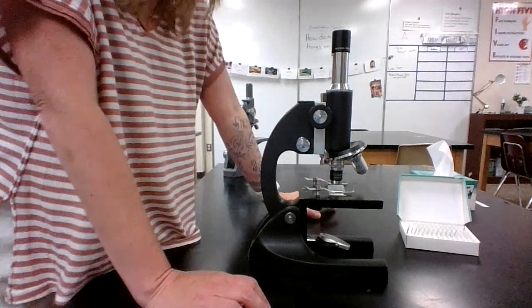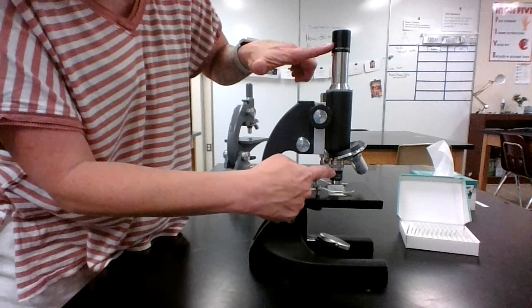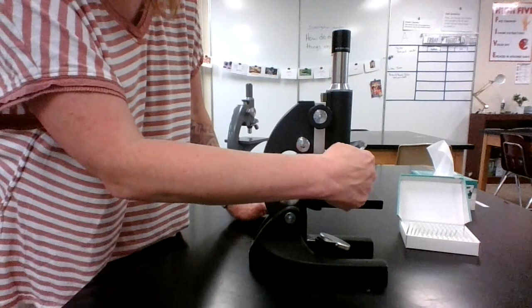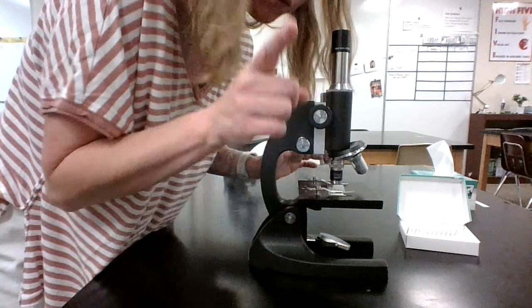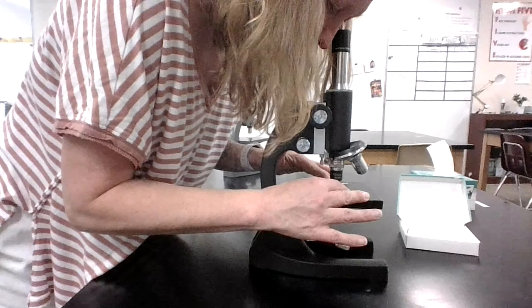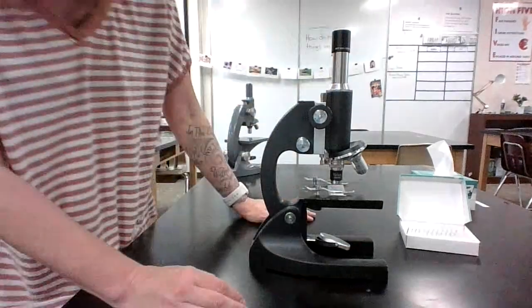All right, now I want to see if I can look at it even closer. Remember I said this is a 10x and this is a 10x, so I'm looking at 100 times bigger than what it really is. If I switch over to this one, the 40, I'm going to see it 400 times greater. So I want to make sure, first of all, that my specimen is centered. If you've got one of those little needle things in there, make sure there's something that you want to see right on that needle area. And I've got that exactly where I want it.